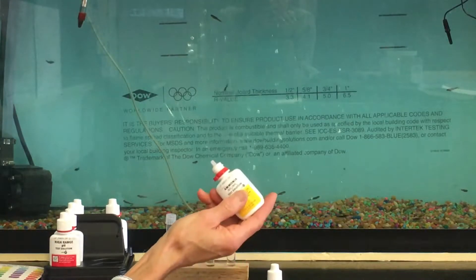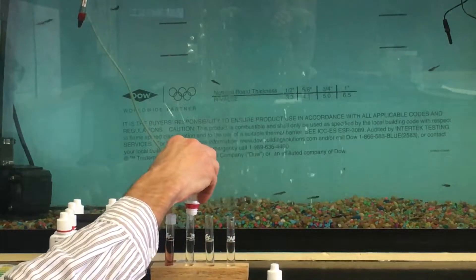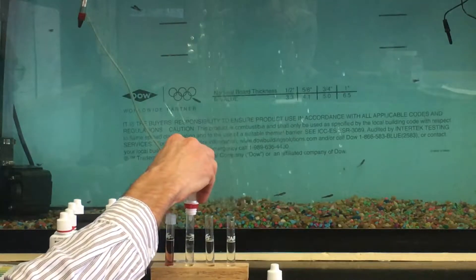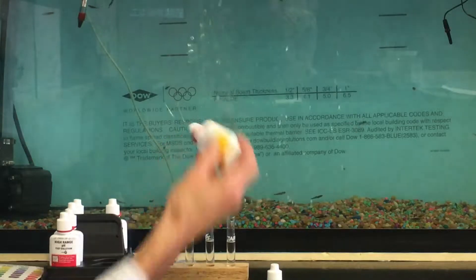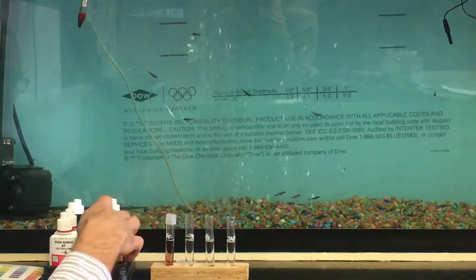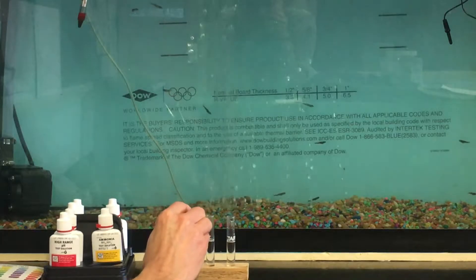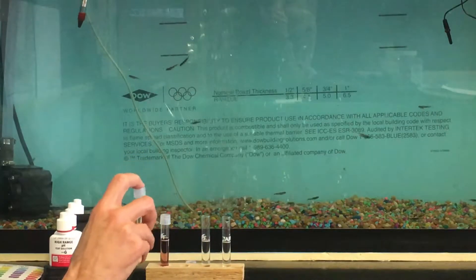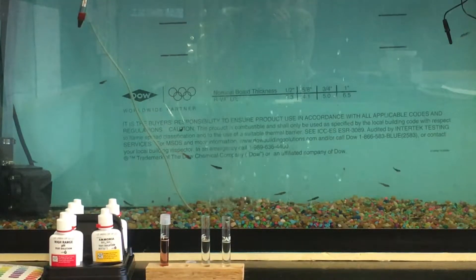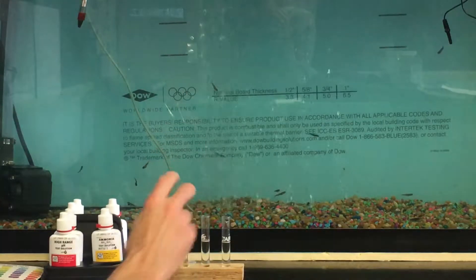Come back and do ammonia test bottle number two — again eight drops. Bottle number two can be added directly after bottle number one: one, two, three, four, five, six, seven, eight. Lift it straight out. Cap the test tube with the plastic cap, keep your finger on top, and shake this one vigorously for five seconds: 1001, 1002, 1003, 1004, 1005.